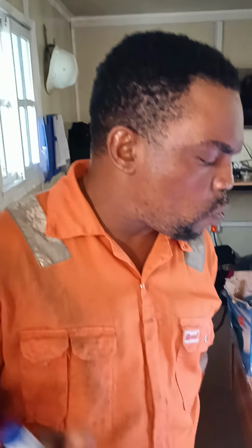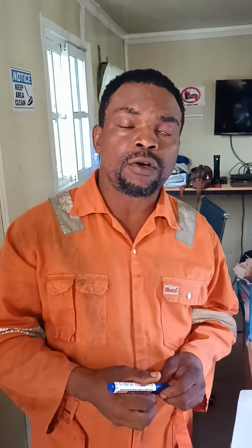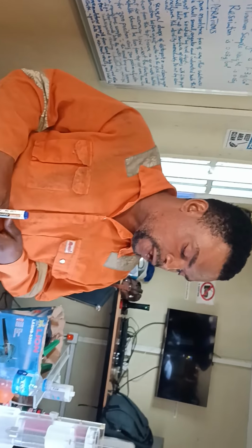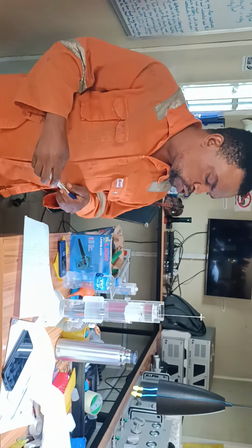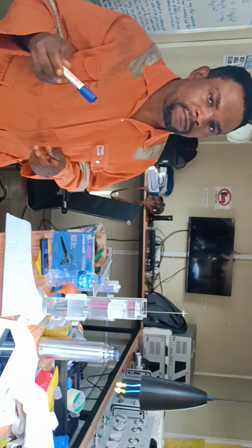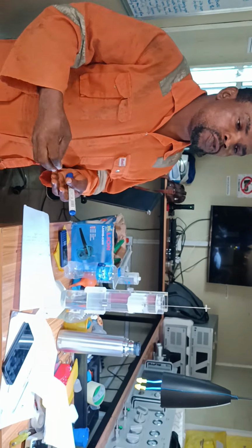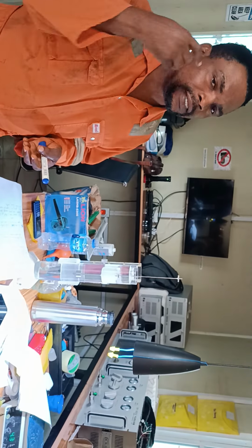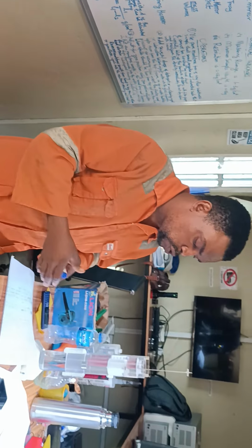One of the advantages we saw is it uses a small quantity of shale cuttings, greater than or equal to 0.05 gram and less than or equal to 2 gram. So it should be above 0.05 gram, your cuttings. You don't really need to measure this. Once you have measured once, maybe you see that it is about 0.2 gram or thereabout, you just use it. Then you don't really need the weight that much. So you just continue to use that.